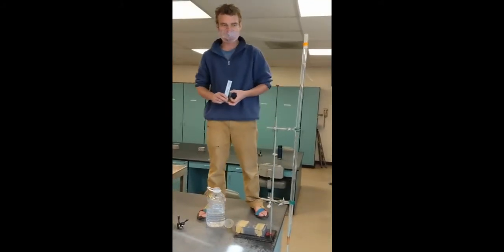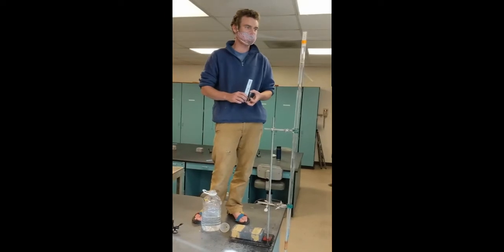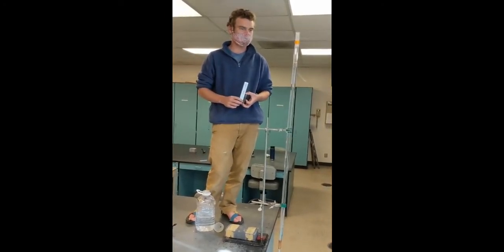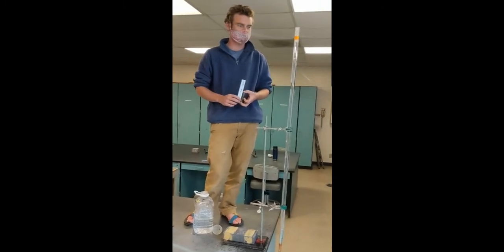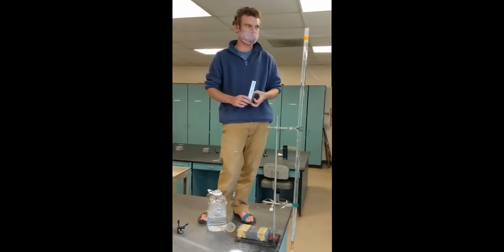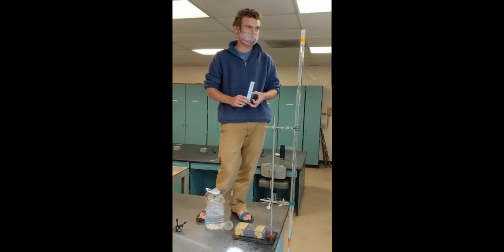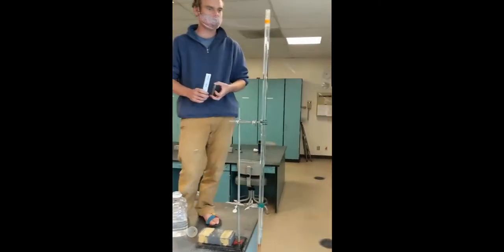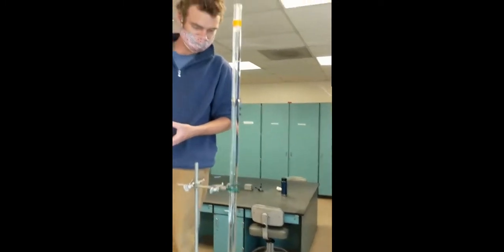Now, there are different ways of quantifying the proportion of sediments of different sizes in samples. One is to put it through sieves. So we could actually use sieves, washing a sample through a sieve and quantifying or weighing the amount of different sediment types on a sieve. The other type is what we see here. So let's look at this apparatus for a second.